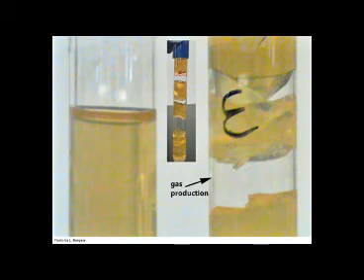Here, E. coli in anaerobic conditions used fermentation with gas production. Gas production is obvious by the presence of the fissures and cracks in the media. So much gas was produced by fermentation in this particular tube that the media actually slid up the tube and into the cap. Upon lifting the cap, you would see that E. coli was present on the surface of the media. This indicates that the organism was capable of growth both in aerobic conditions at the top of the tube and in anaerobic conditions all the way to the bottom of the tube.